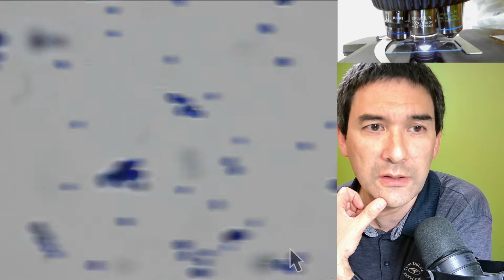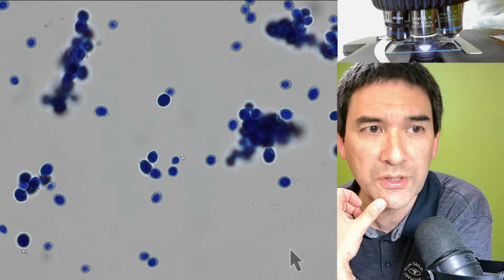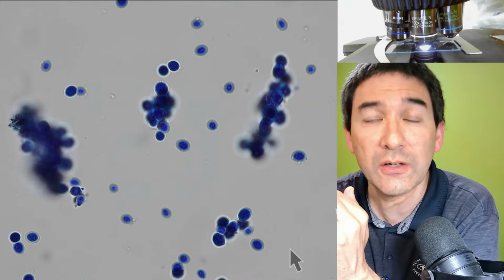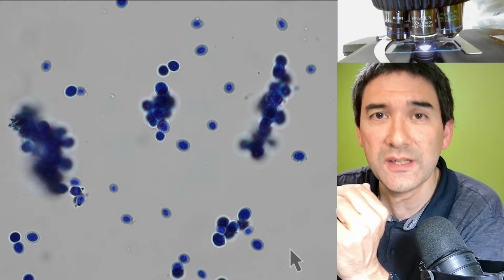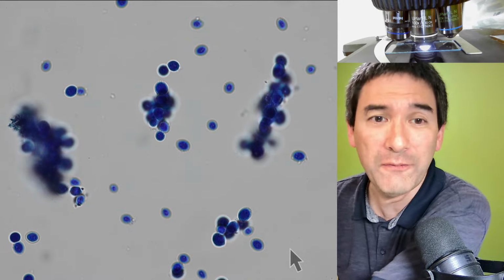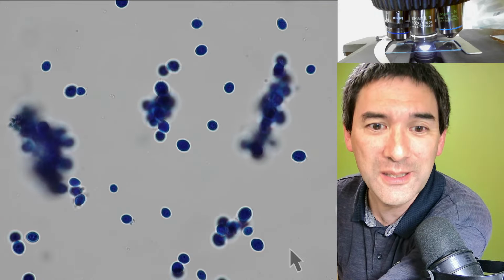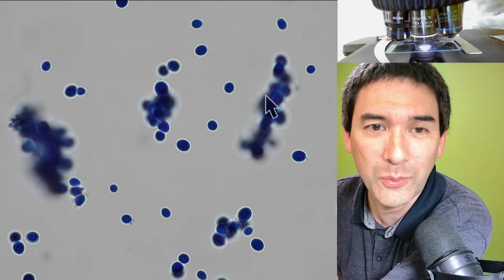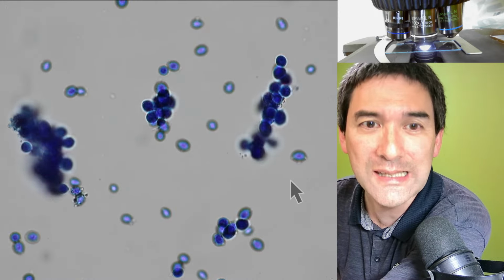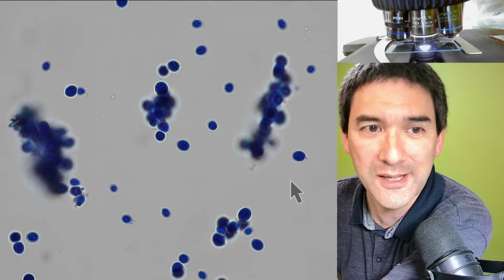But I think you already notice something, and that is that some of the cells are out of focus. And why is that? Well, obviously because they are in liquid, and this means they're not baked to the glass surface, to the slide, and that means they're still able to move. And if I'm now focusing a little bit, you can actually see some of the cells wiggle back and forth, again because of this slight pressure that the oil exerts on the cover glass.